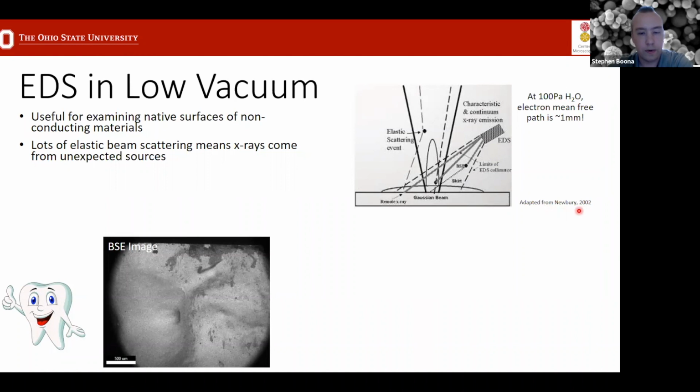But this is a particular paper from 2002 where he describes some of the issues that come up with low vacuum EDS analysis. Part of the problem is that what you expect to happen under high vacuum is for the beam to follow the dark line here and have a well-defined spot that it hits on the sample surface with an intensity distribution that roughly corresponds with this Gaussian shape. The problem is that when you have a lot of vapor inside of the chamber, as you do with low vacuum operation, the beam is going to undergo a lot of elastic scattering, meaning that an electron that was supposed to hit the sample here is going to get deflected somewhere and then end up hitting the sample over here. And so the software thinks that the beam is here, and it's correlating that with an X-ray that was detected after being generated actually somewhere over here.